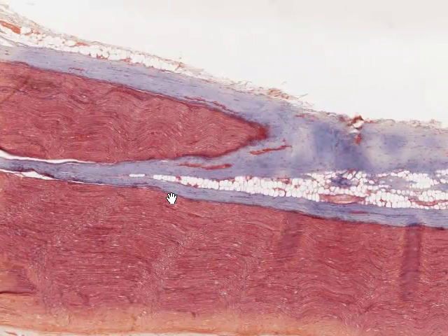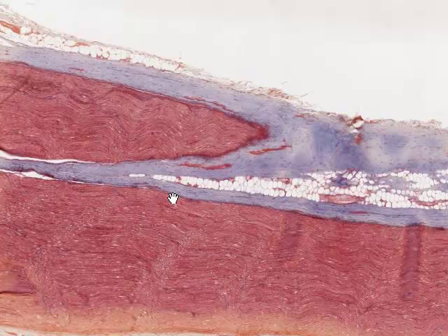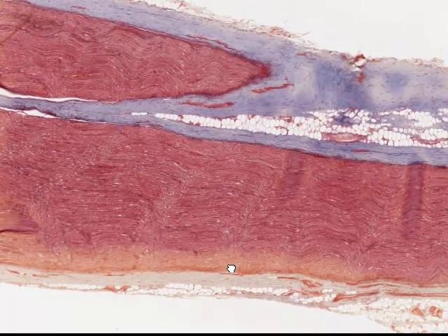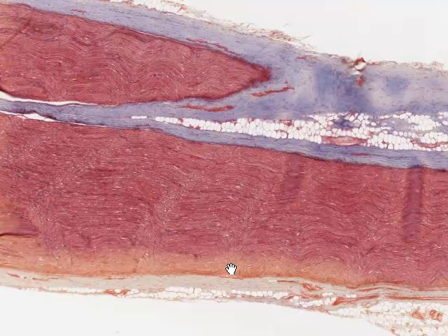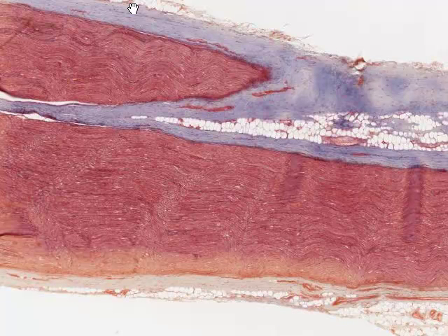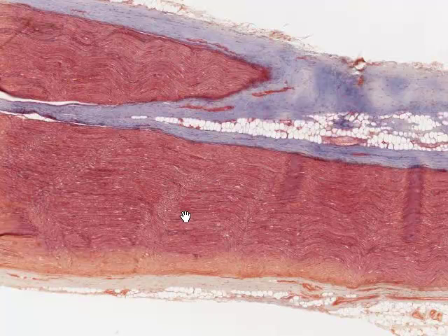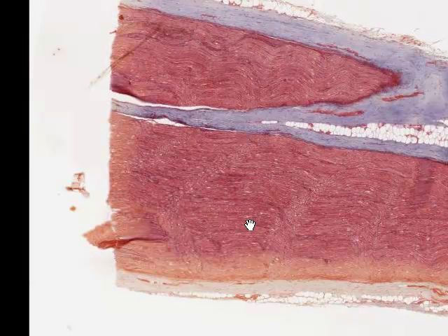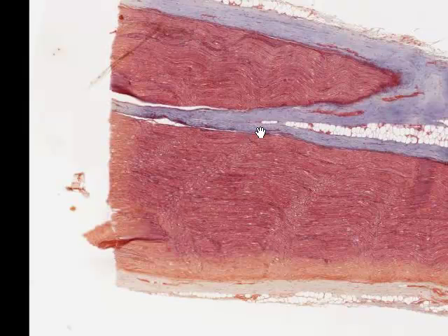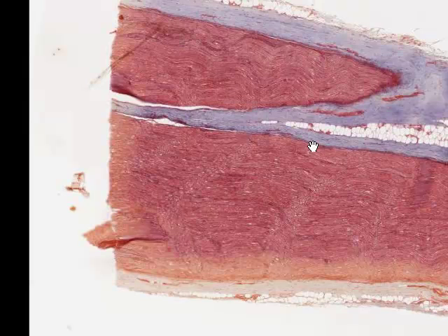Nerves are made up of individual bundles of axons called fascicles. This is a fascicle cut in longitudinal section, and this is another fascicle cut in longitudinal section. Fascicles are bound together externally by a connective tissue layer known as the epineurium, which encloses both of these fascicles. Individual fascicles are surrounded by a connective tissue layer called perineurium, which is associated just with each individual fascicle.